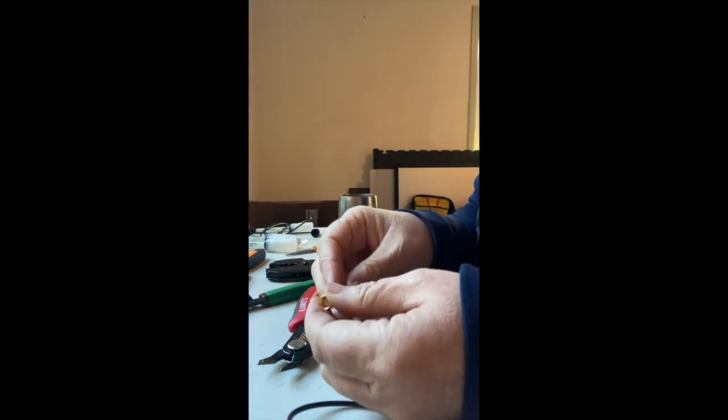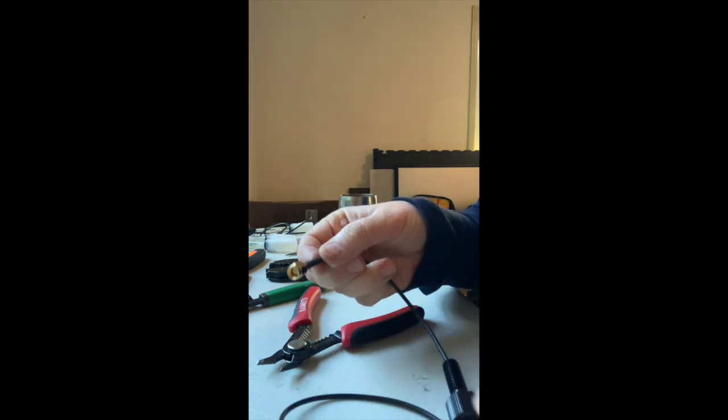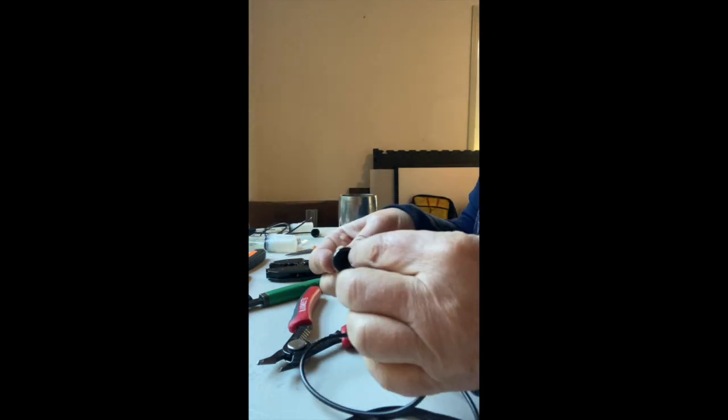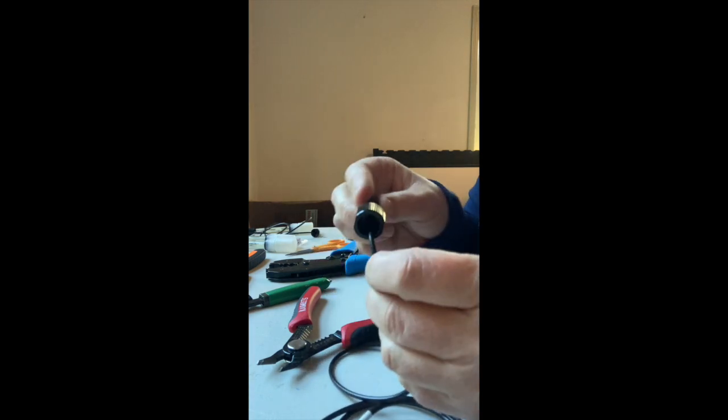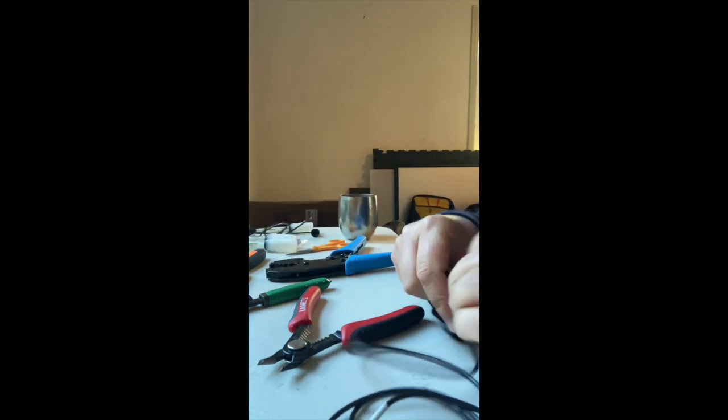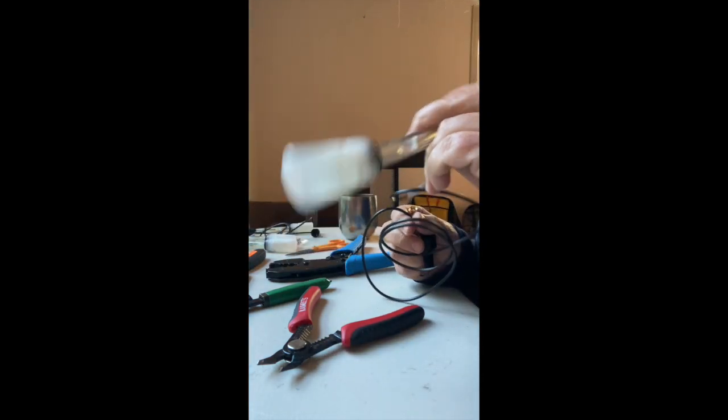and then shrink wrap. My torch is out of butane, so I'll have to do that some other time. And I'll have to put epoxy in here to seal the hole, and then it will be watertight, and the electronics can be on the inside, and the sensor can be on the outside.